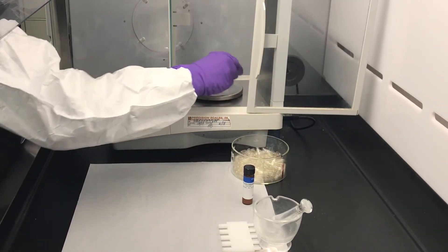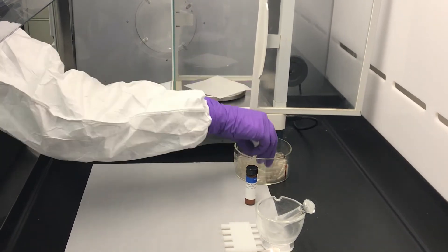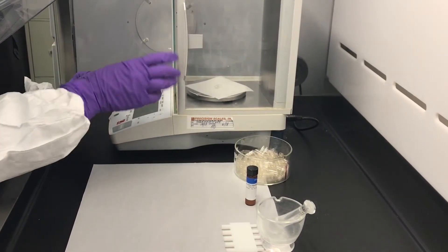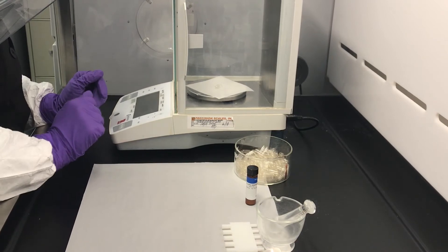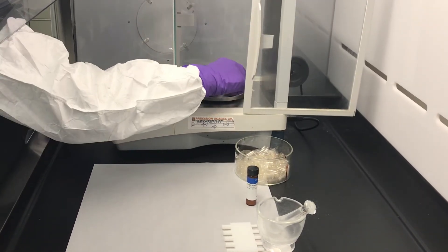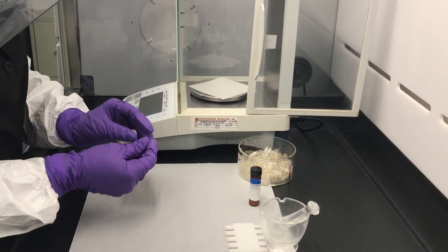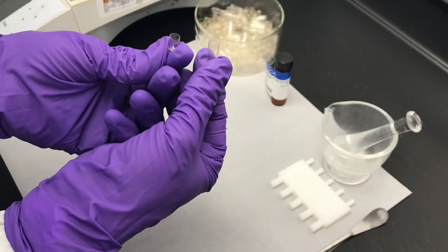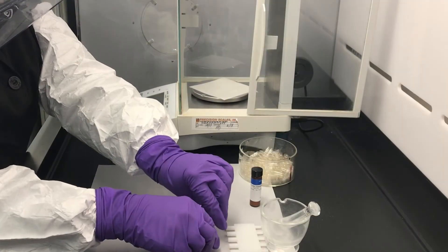First, place a clean piece of weigh paper on the balance. Place an empty size one capsule on the balance and tare the balance. Now open the capsule. You will use the bottom portion of the capsule to tamp the powder into the capsule.